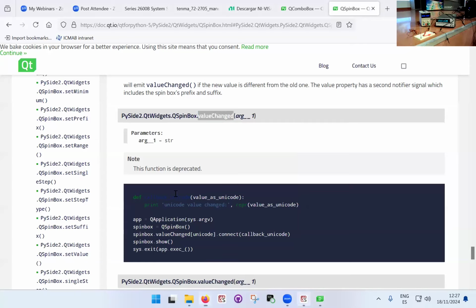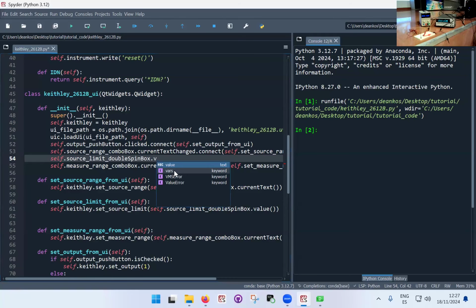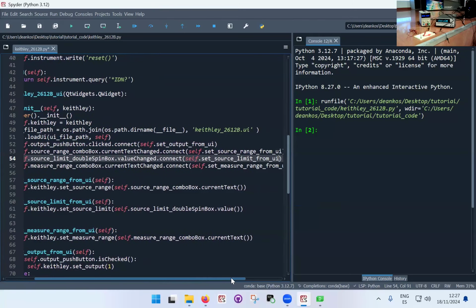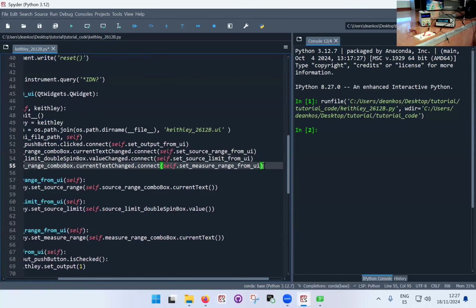Copy this. Value change dot connect. So when the value of the spin box is changed, we connect it to set source limit from UI. Okay, so that's that done, and we're missing one more function.